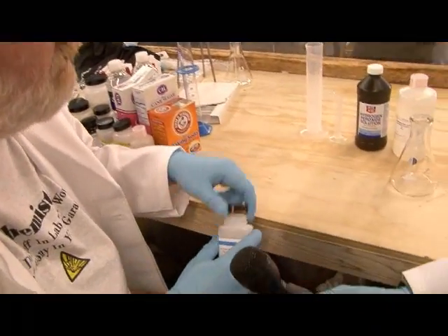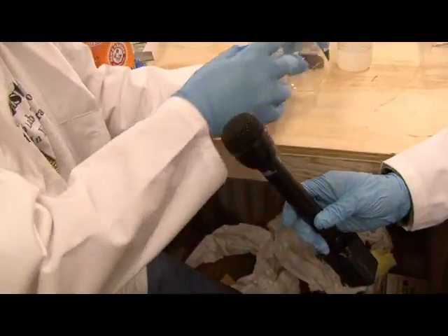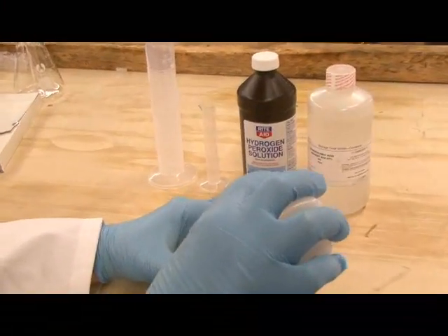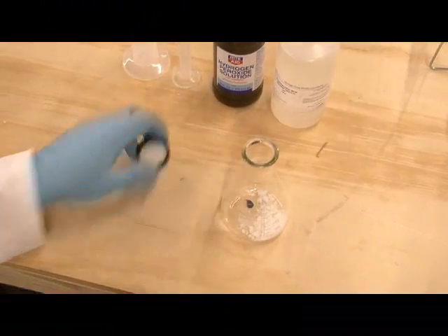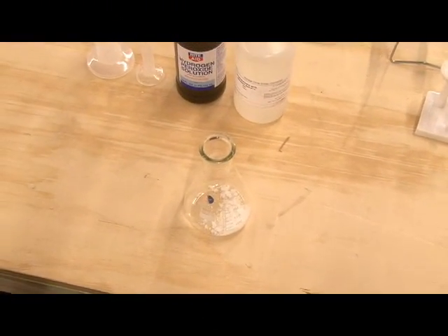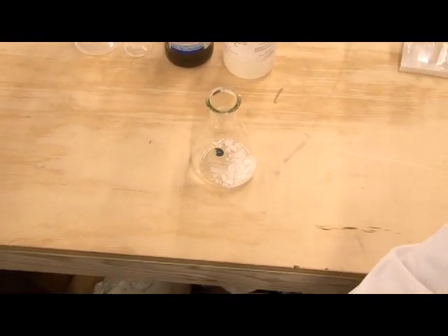What I'm going to do is dissolve a little bit of this potassium iodide. Ordinarily, working in the lab, I would weigh it out, but I'm just going to eyeball it right here. Bob, what would this normally be used for — potassium iodide?